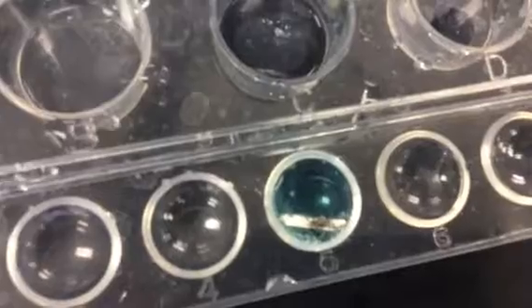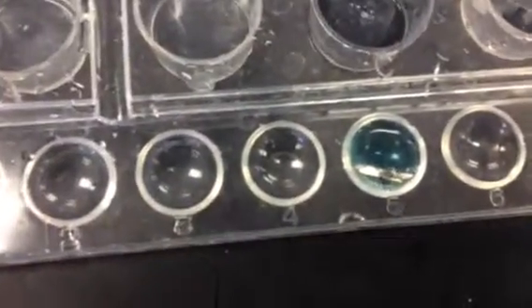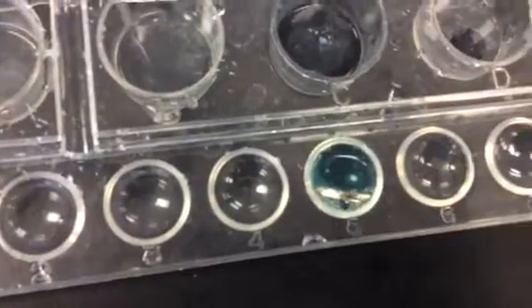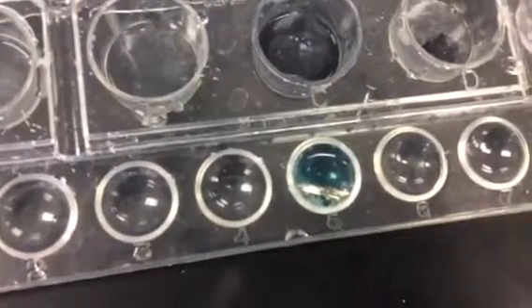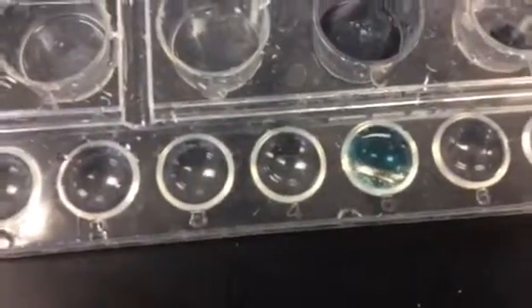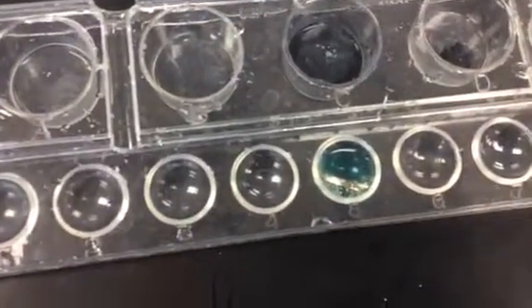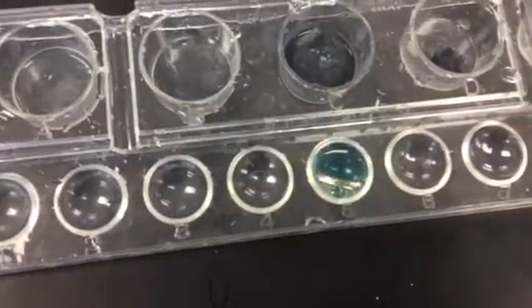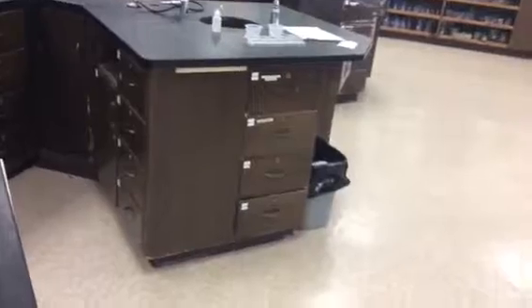Okay, so this one's a little harder to see, but there is a little bit of what looks like bubbling going on, and the magnesium is beginning to get discolored, so it's kind of turning brown. So go ahead and write down any observations that you have and whether that is a chemical or a physical change. Alright, so that's today's lab. Hopefully you enjoyed doing this by video. And we'll see you in class.